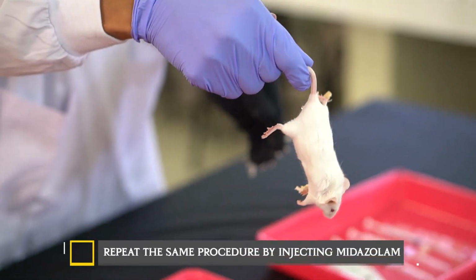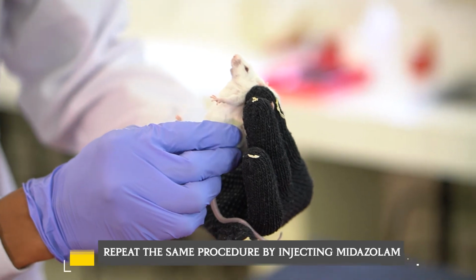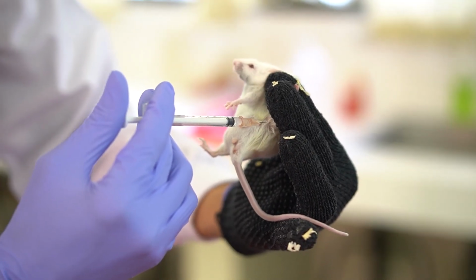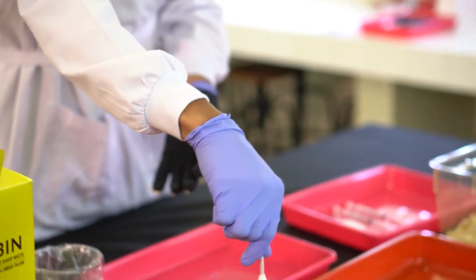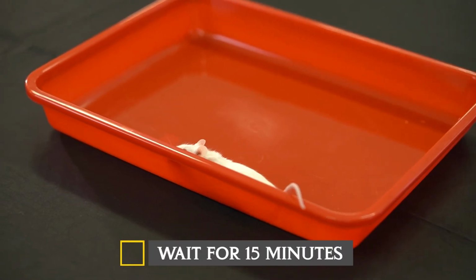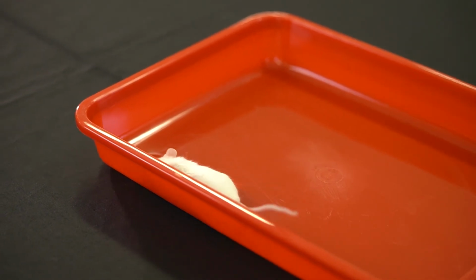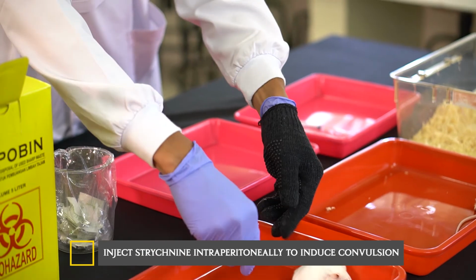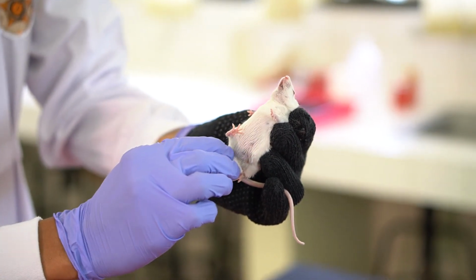Repeat the same procedure by injecting midazolam to another mouse. Wait for 15 minutes. After 15 minutes, inject the strychnine intraperitoneally to induce convulsion.